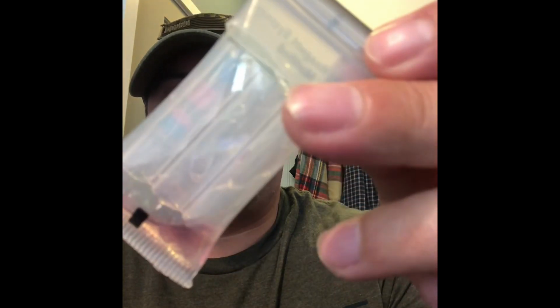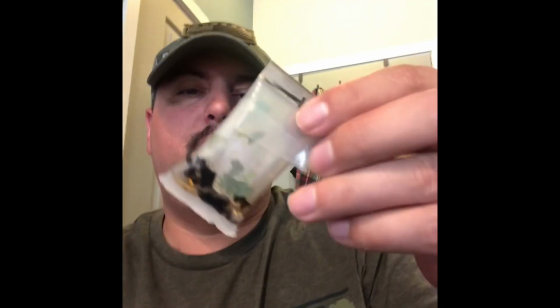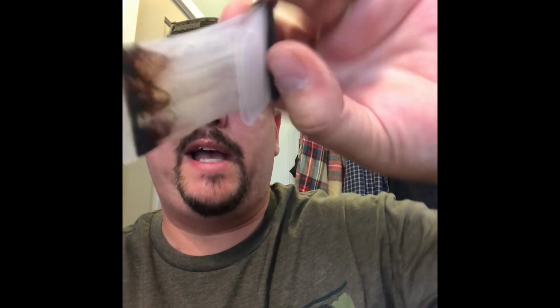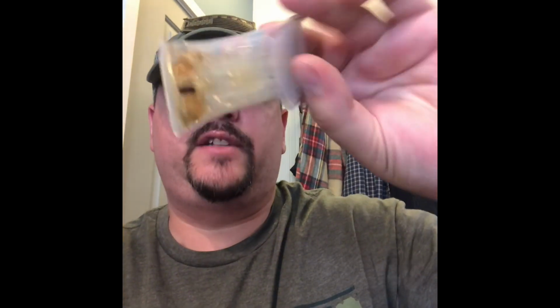I mean, if they're working with law enforcement, why are you going to test an empty test kit and talk about how it's alarming that there's a positive? Really, is that really a positive? I wouldn't say that that's a positive based on my knowledge, training, experience. I just wouldn't, outside of the fact that there's nothing in there. And then you have the other kits, which are just sitting here. That one just looks like crap. Not a green positive for heroin. This is the meth. Yeah, that's not a positive for meth. Any officer in their right mind wouldn't. Oh, sorry. And then I have the cocaine. Yeah, that's not a positive.